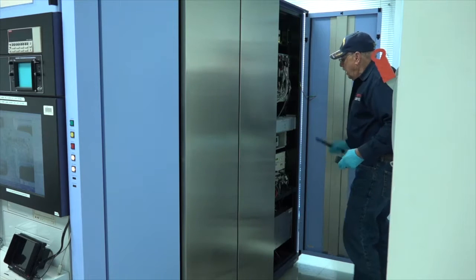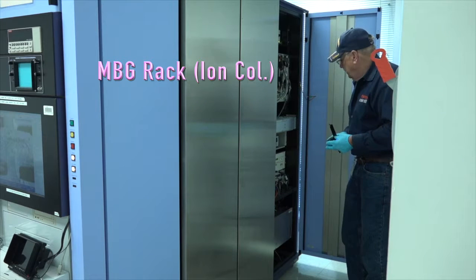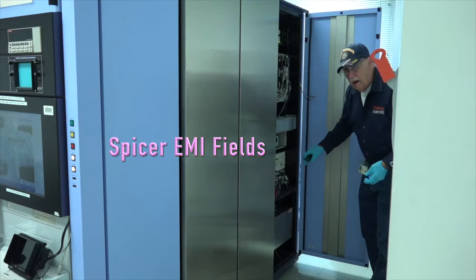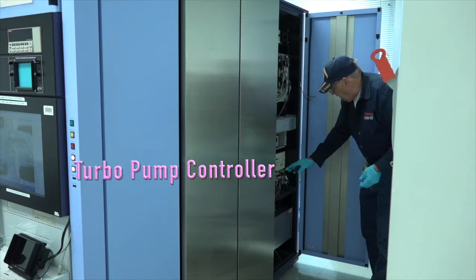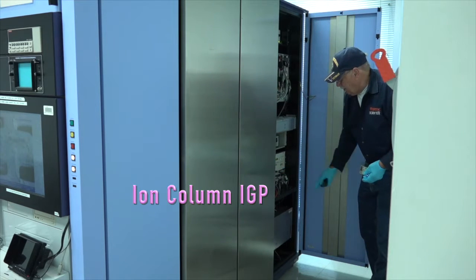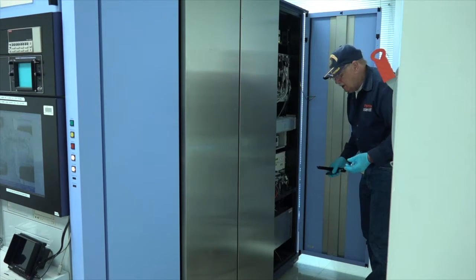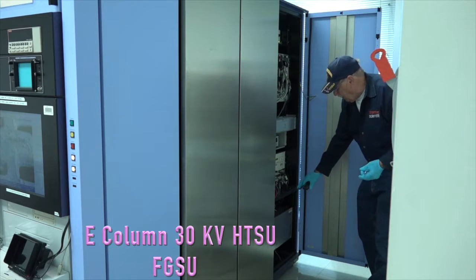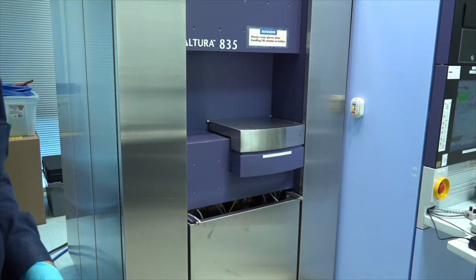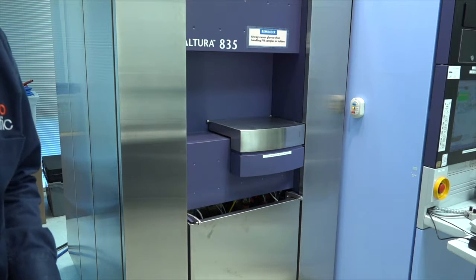Okay. And behind this door is the electronics rack for the I column. It's got a flotation table, the spicer, field cancellation, and the turbo pump controller, as well as the IGP for the ion column. We have one ion getter pump on the ion column. We have 2 on the E column. And the power supply, high tension power supply. Now we're going to open up the front panel so you can look inside to the chamber area, and that's the fun part.